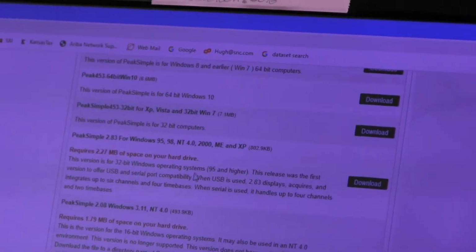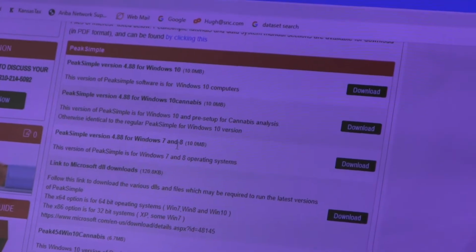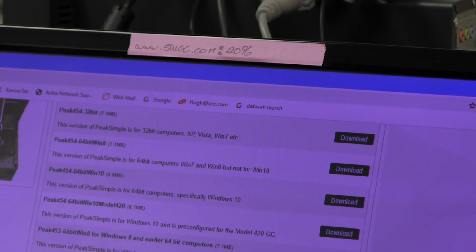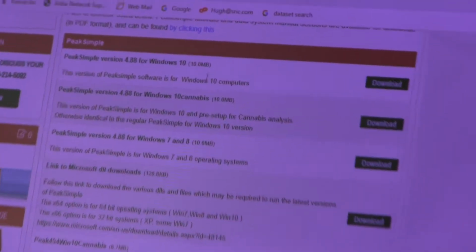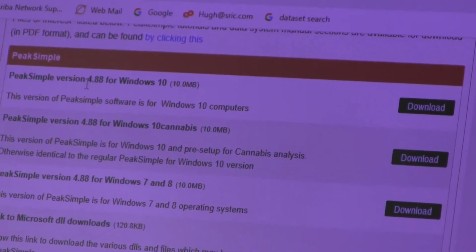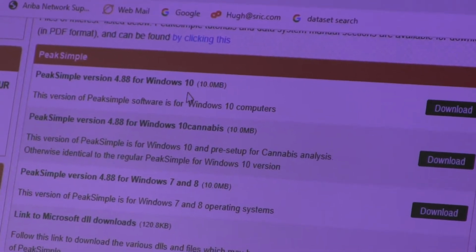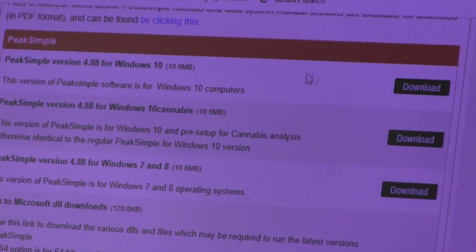This page shows all the different software downloads for different operating systems such as Windows 10, Windows 8, Windows 7, XP, all the way back to DOS, which is back in the 1990s. We have versions covering all those different ones. But normally you would download the latest version unless there's some reason not to. So I'm going to download this version called Peak Simple version 488 for Windows 10. By the time you see this video, that version number may have changed depending on when you do this download.